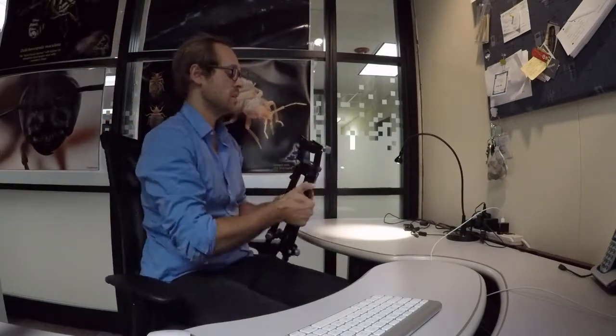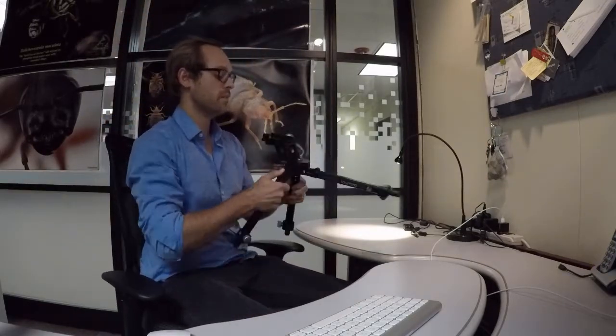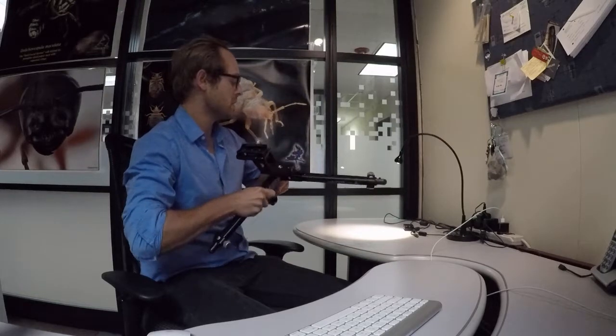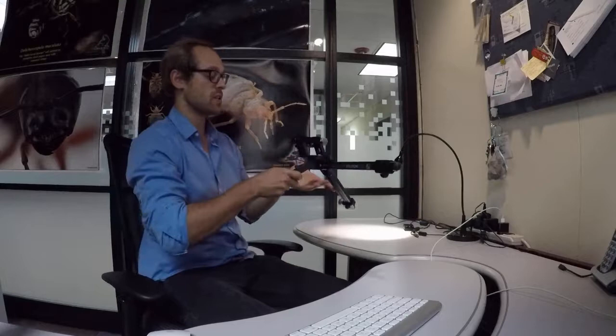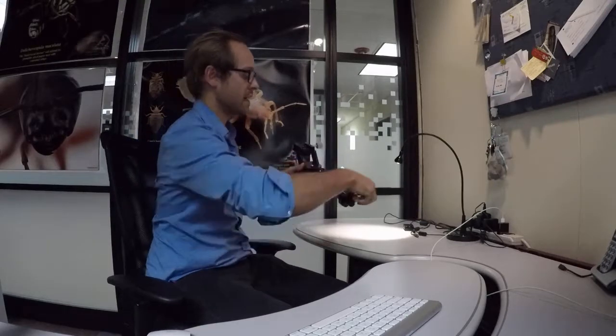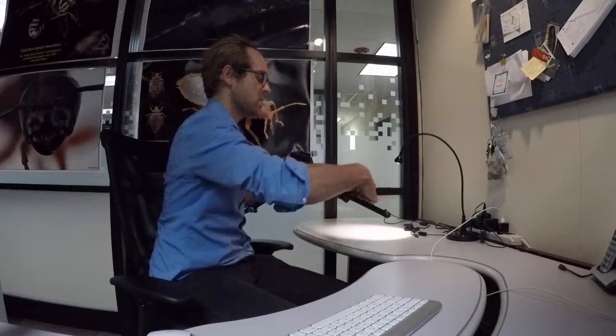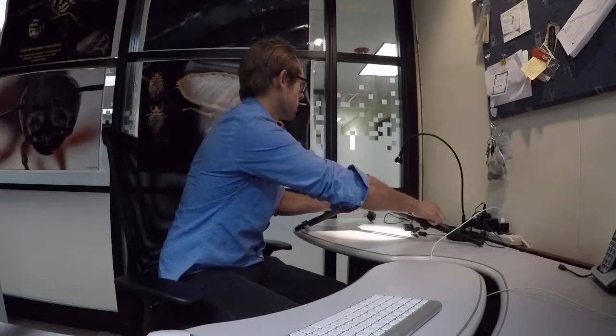So we're going to get started with the Macropod tripod. We'll just open this up in its standard position where the back legs are in their 60 degree position and your front leg is extended the full 90 degree position. You're going to set that up wherever your workstation may be.